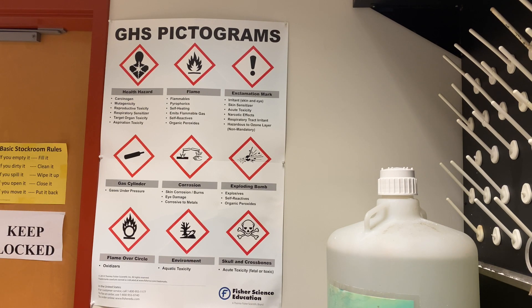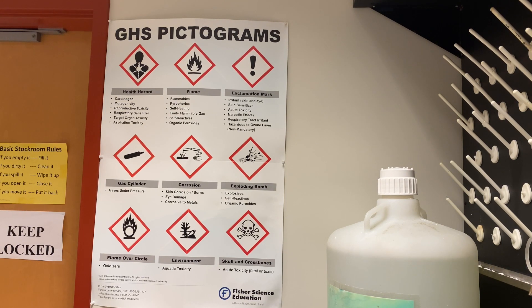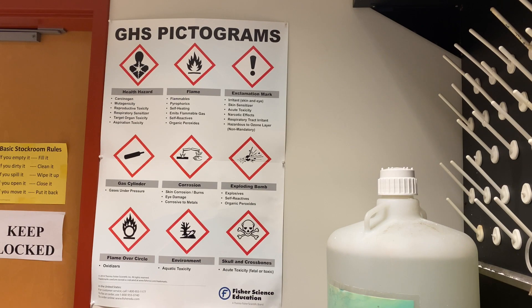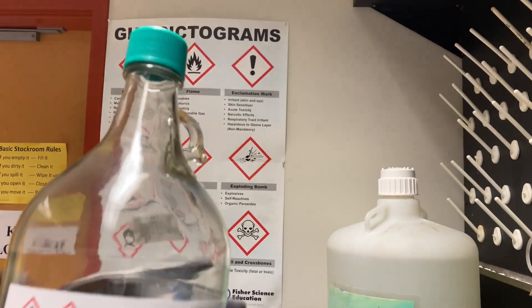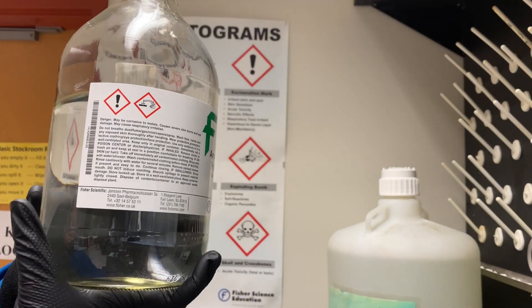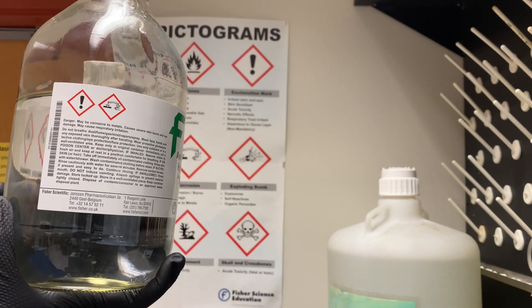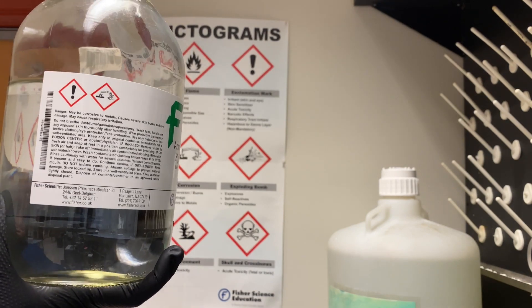In regards to chemicals, here's how you can tell which GHS labels are applied. As you can see here, there is an exclamation mark and a corrosion symbol.